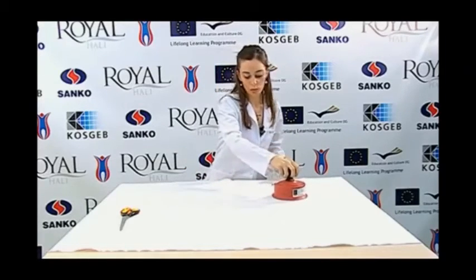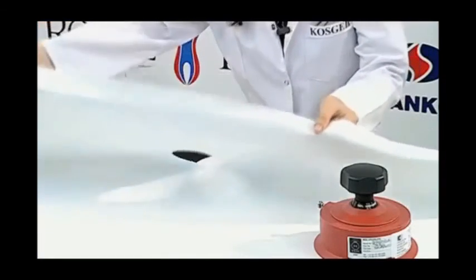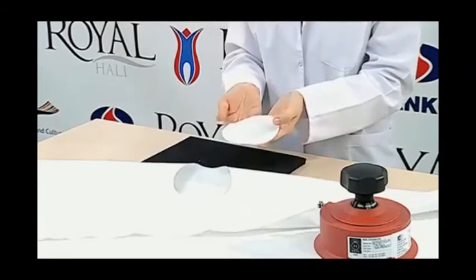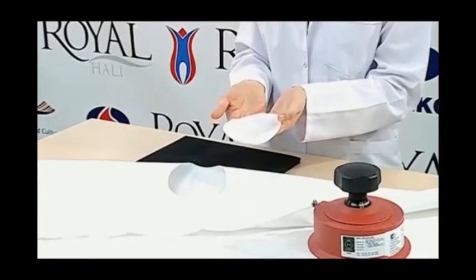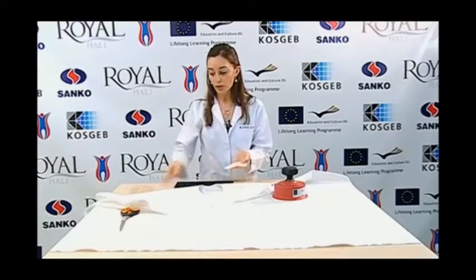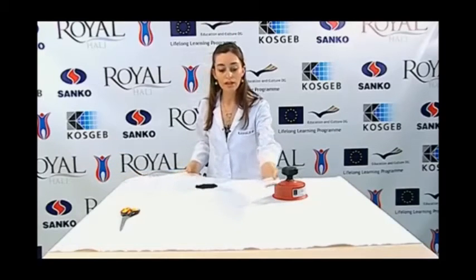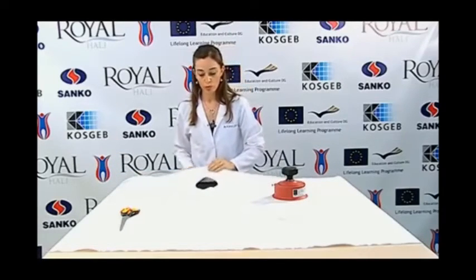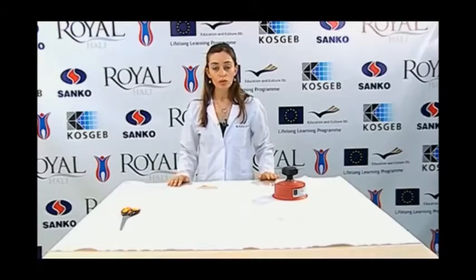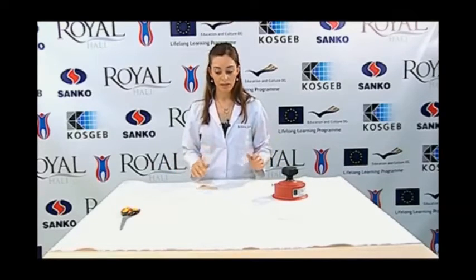We lift the sample holder. Then, I lift the sample without causing any yarn loss. This way, I complete the preparation of the sample of a 100 square centimeter circular area. I repeat the same task 4 more times to have a total of 5 samples. At this point, attention should be paid to taking the samples from different parts so that the samples can represent the whole fabric.